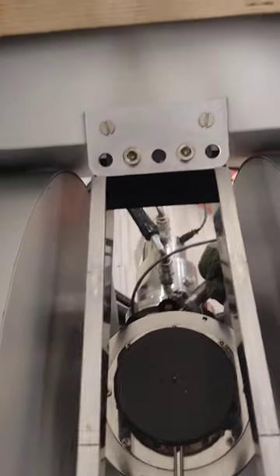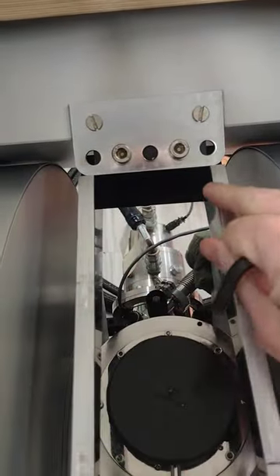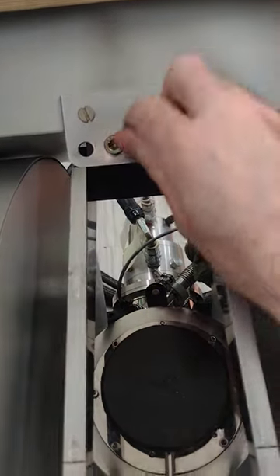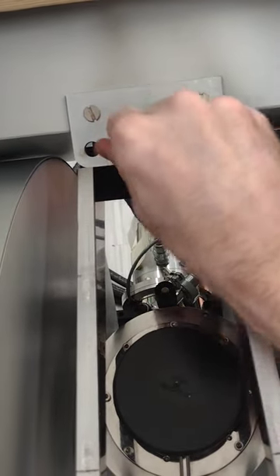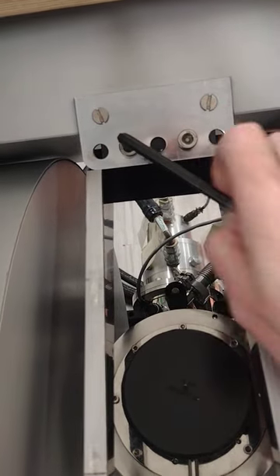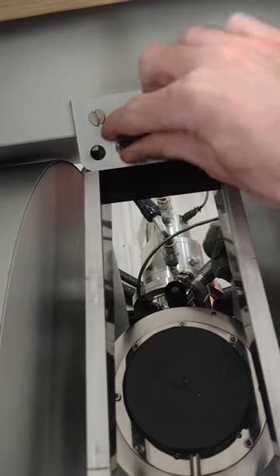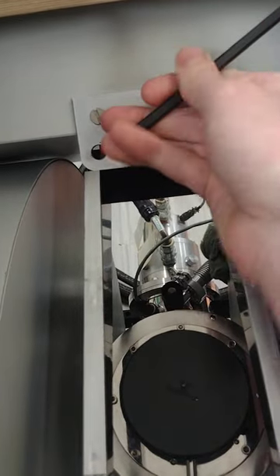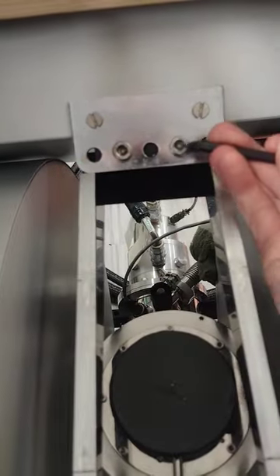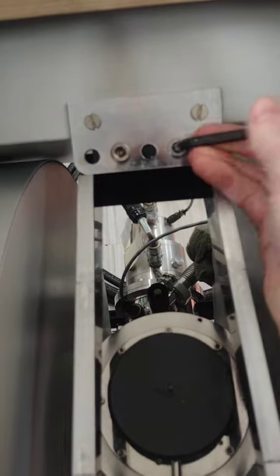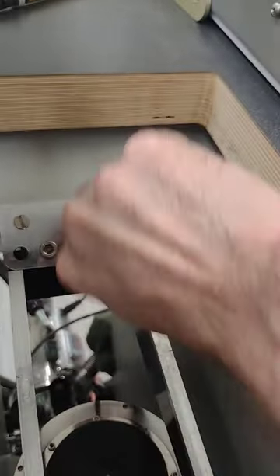So first thing we can do is disconnect this little resonator stabilizing mount that was installed in our magnet. I do that by just getting my, I believe this is the 6 millimeter Allen key, get that in there and just loosen these guys to start and then take them out.